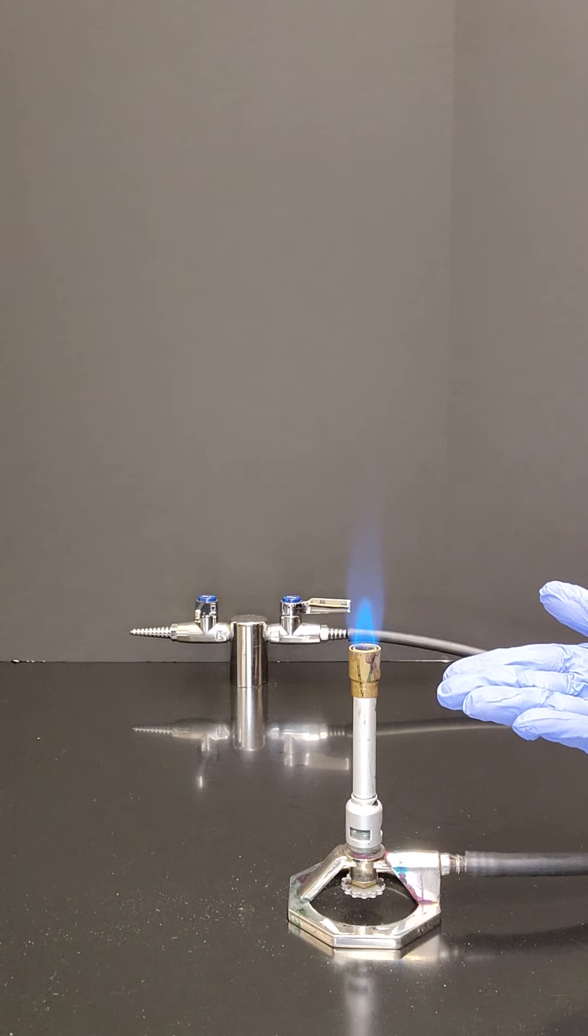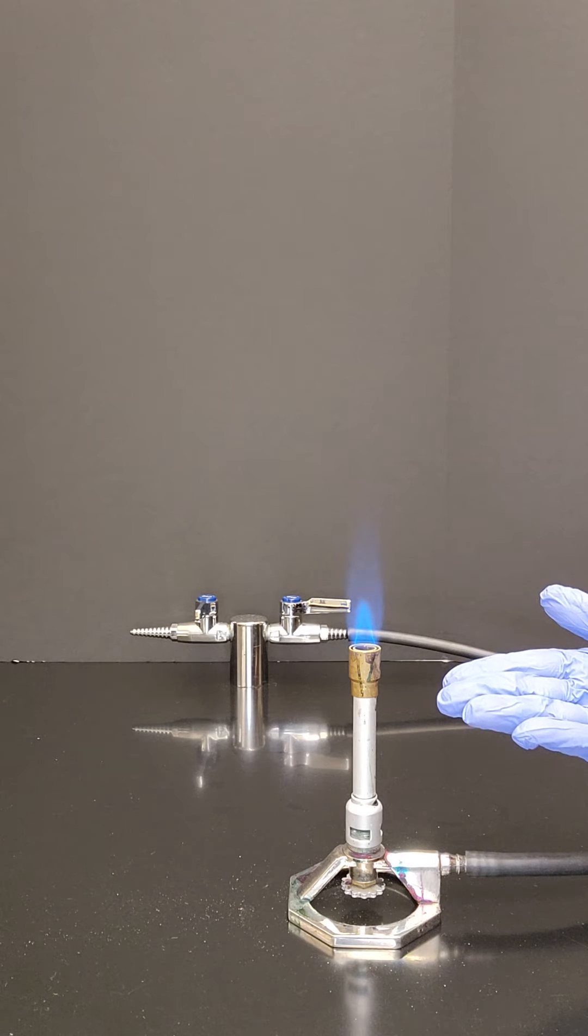If you do not see a flame like this you have two different adjustments that you can use on your burner.